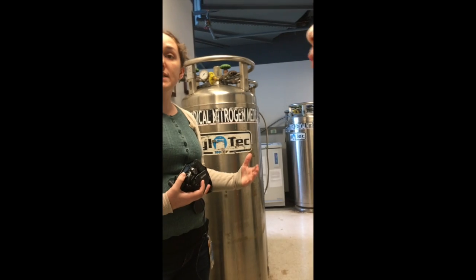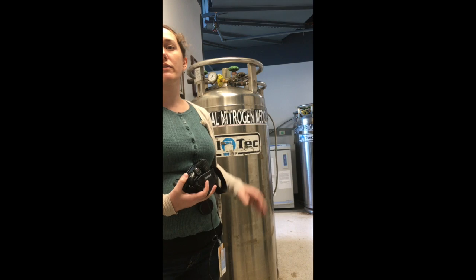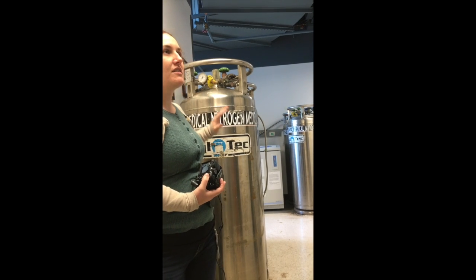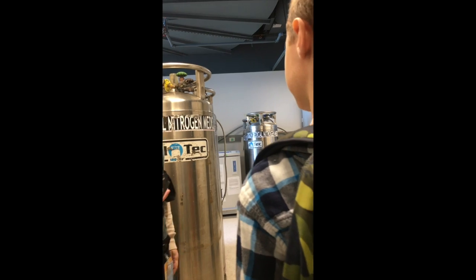Some other samples don't need that to that extent, so we just put them on ice until we get the window going. But for the really important stuff, you're dealing with enzymes, the molecular reactions, all the nitty-gritty stuff we don't see. Put in liquid nitrogen.